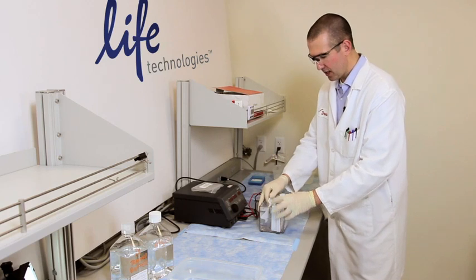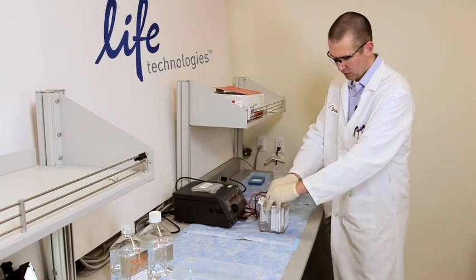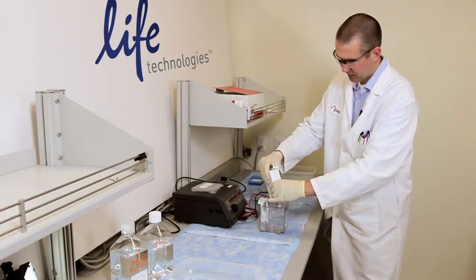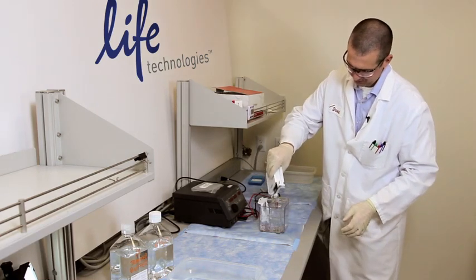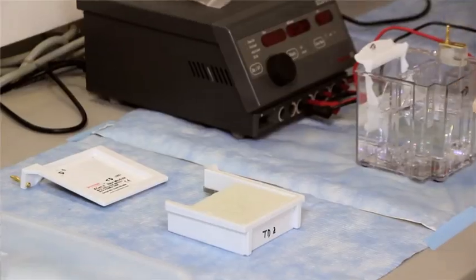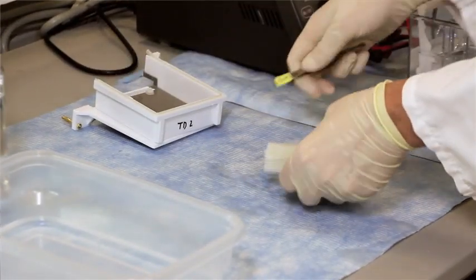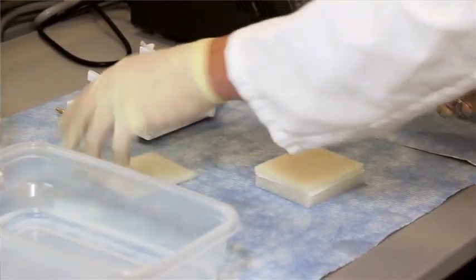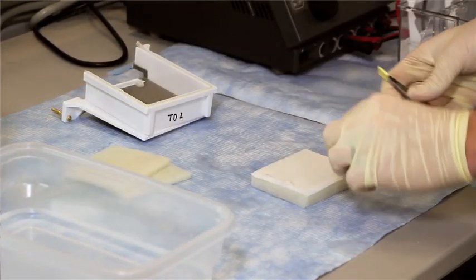and disengage the clamp. Take out our blot module. Get our forceps. Take off our two sponges and our single filter paper.